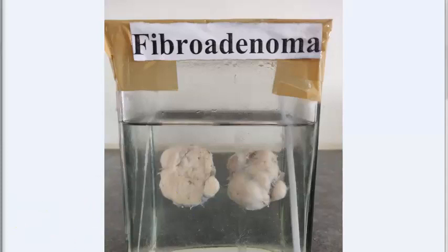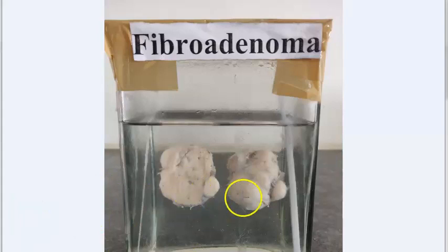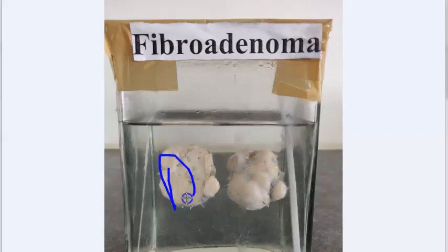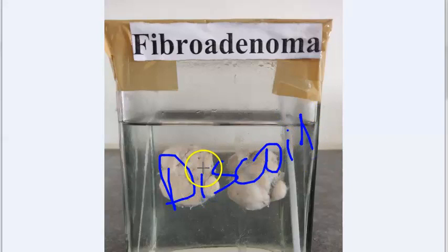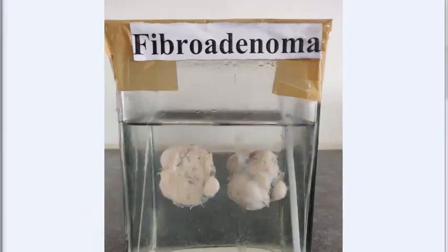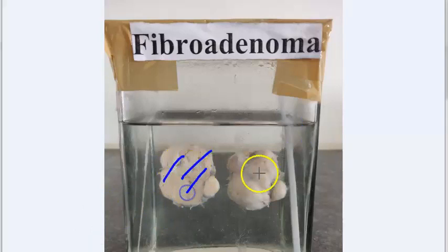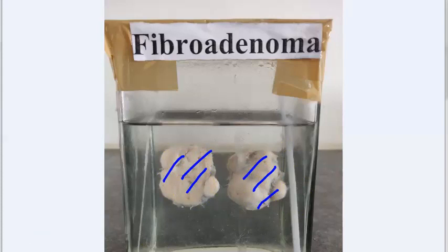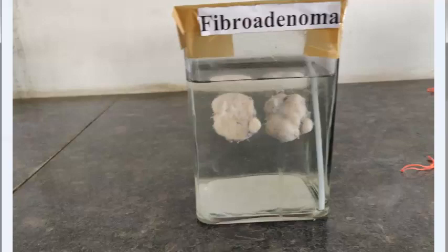Breast fibroadenoma is the most common benign tumor of the breast, usually affecting people of reproductive age. You will see a small, solitary, well-encapsulated discoid mass — remember, discoid mass. When you cut it, you will see firm gray-white myxoid slit-like spaces — you should see slit-like spaces. In microscopy, you will see intracanalicular and pericanalicular patterns.